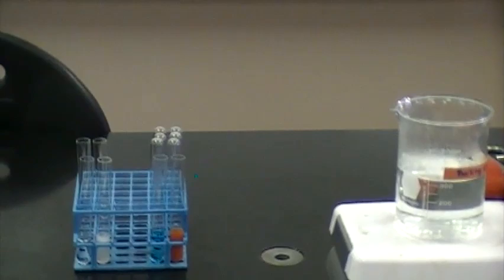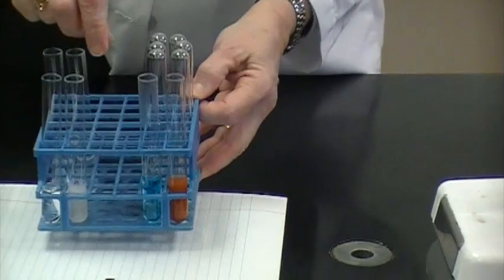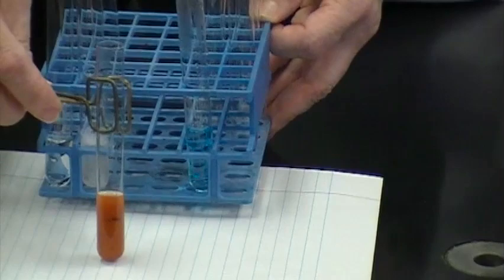Comparing the tubes to the control you will see that the color change is obvious. This is one positive test that can result using Benedict's test.